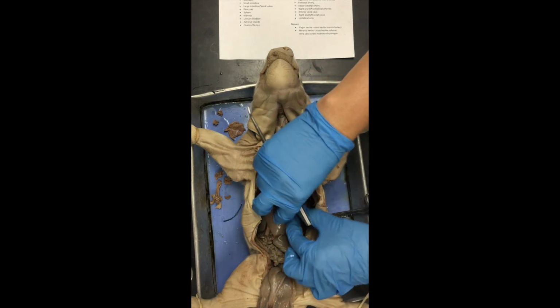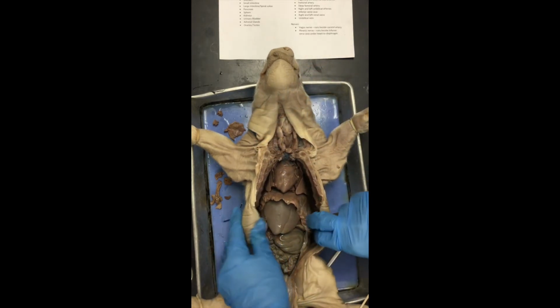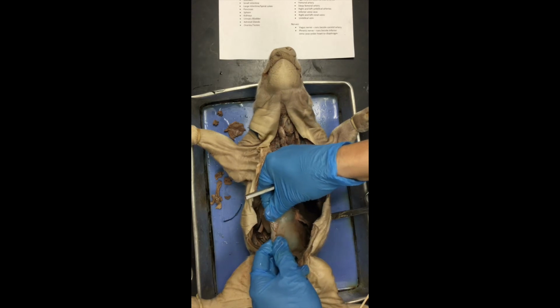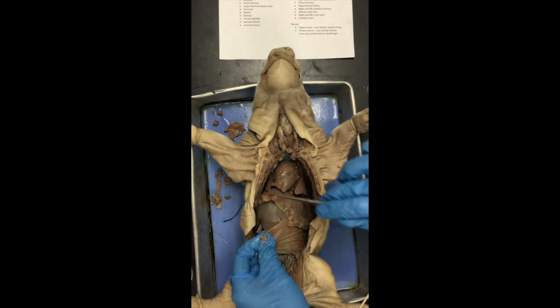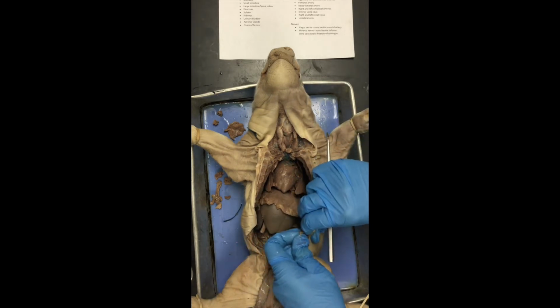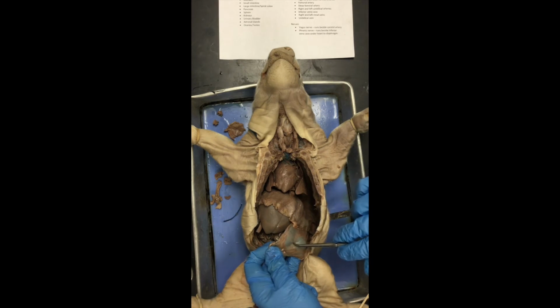Okay? Now coming down to the abdominal cavity. Down here in the abdominal cavity, we're going to have the peritoneum. Now the peritoneum is that membrane right here that we had to cut through. Remember, it was along the bottom of the diaphragm and we kind of trimmed it off and away. This is known as the parietal peritoneum, okay, because this was attached to the body wall. I peeled it off the body wall.